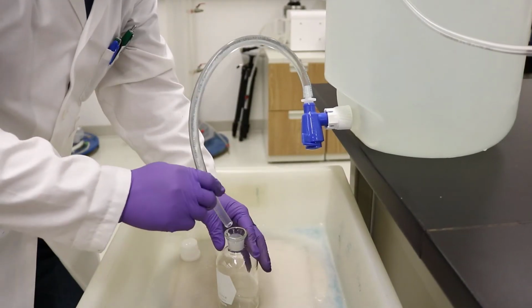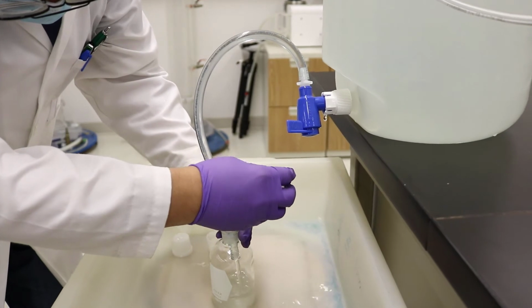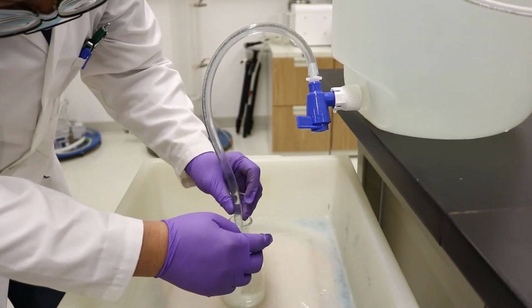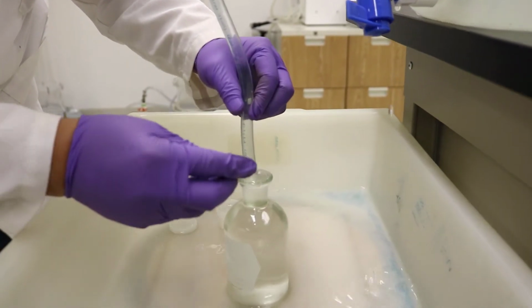In the previous section, we talked about determination of DO using the titration method. Now, we will teach you how to determine DO using a DO meter. Following is the operation procedure. First, fill a BOD bottle with air-saturated room temperature water. This should be done slowly, and make sure there are no bubbles in the bottle. Once the water reaches the middle of the bottleneck, stop filling and put on a stopper. This is your room temperature sample.